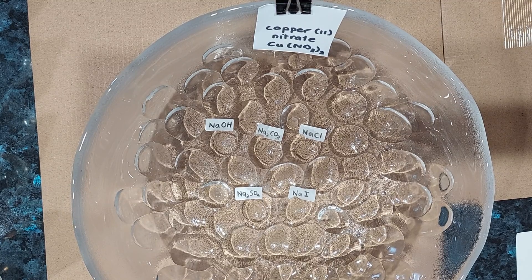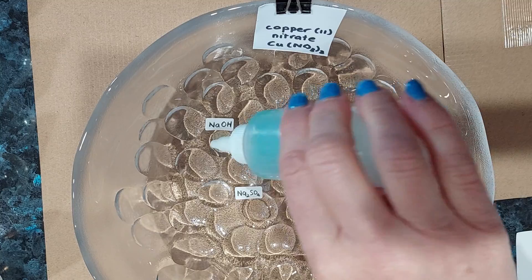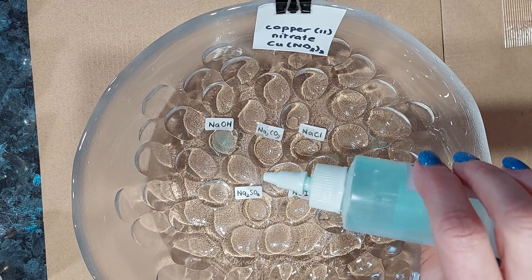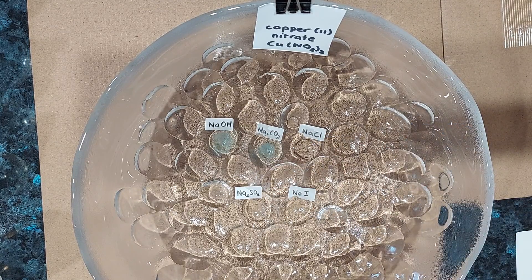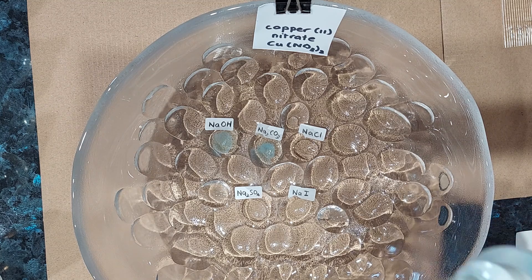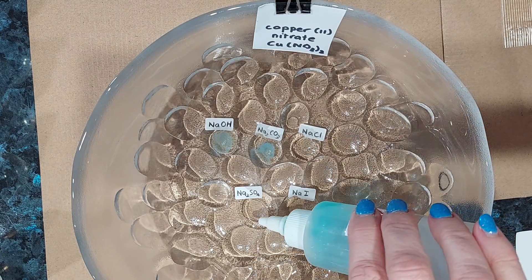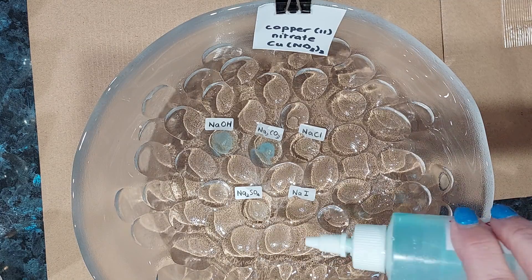Copper(II) nitrate. Let's have a look with sodium hydroxide — it is a very very fine precipitate forming. With sodium carbonate — again we see that fine precipitate forming, taking a little while though. With sodium chloride — nothing. Sodium sulfate — nothing.